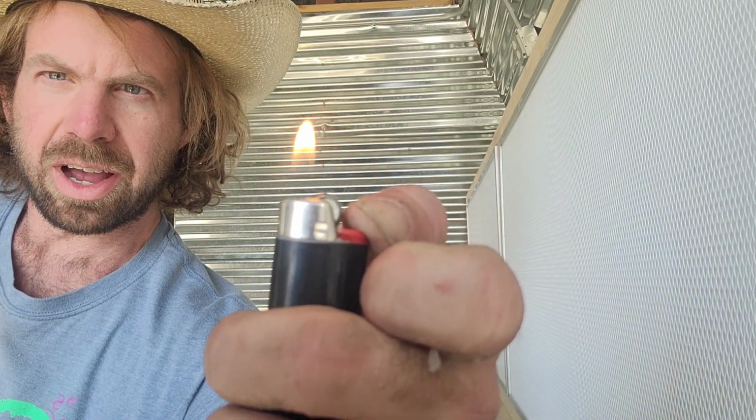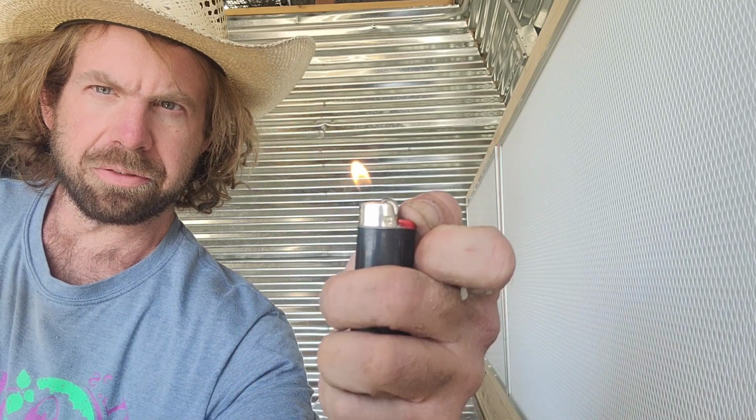And it's going vertical as we get out of the airflow, okay? Back in front of the airflow. It's angled. All right, so that's it. That's what you guys can see. You should just see that flame slightly blow over, not blow out completely, but get close, you know. It is kind of hard to light the lighter in front of the flow hood. There you go. But look how that flame is angled. That's perfect, okay? Now, I want to show you the smoke screen test, all right?